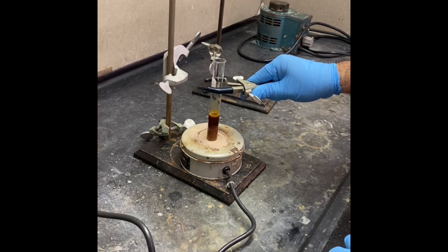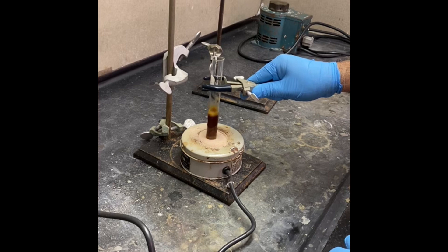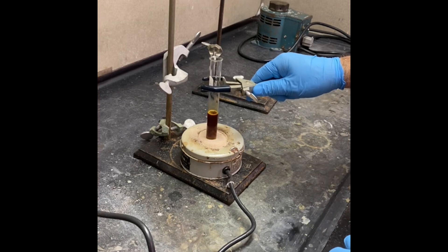So we will stir and boil that for about five minutes.